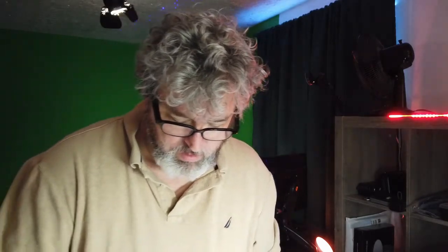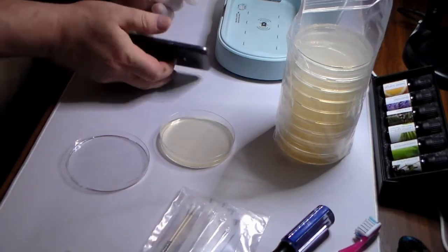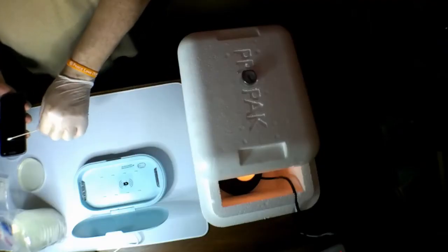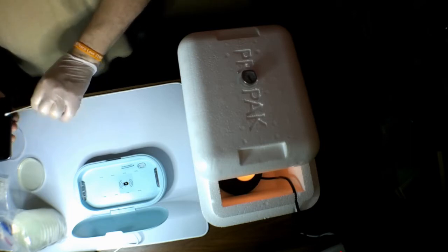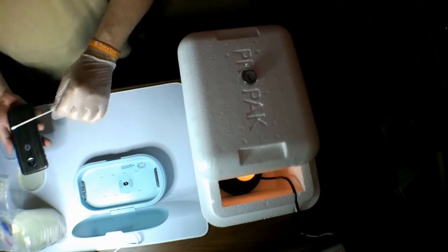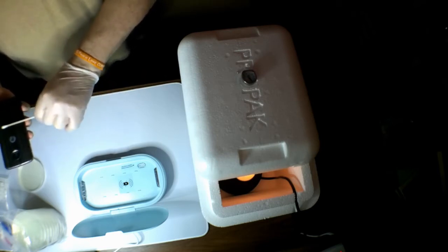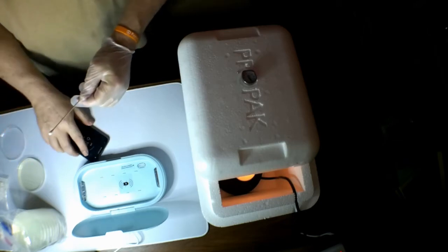So we're going to moisten the swab with the boiled water. We're going to swab the phone front and back, and then we are going to put the bacteria. Now as I'm swabbing this, I'm also turning the swab. I'm careful not to touch my hand. All right, we'll turn this over. We'll swab the back really good. I'm making sure that the swab does not touch anything else other than the thing I want to touch.